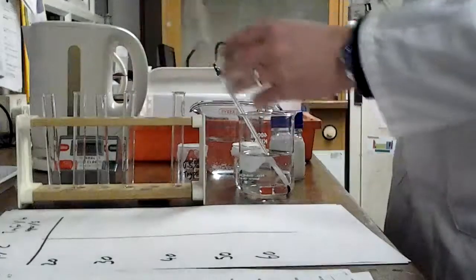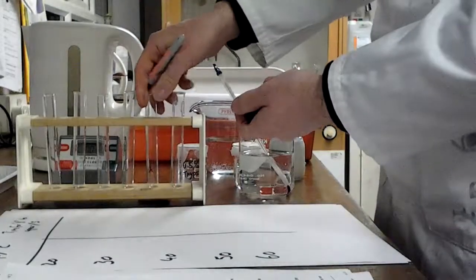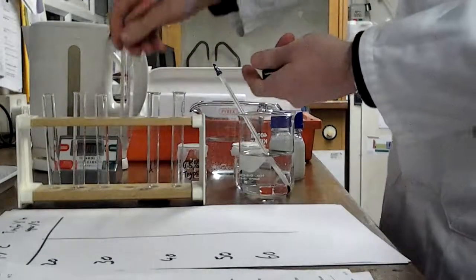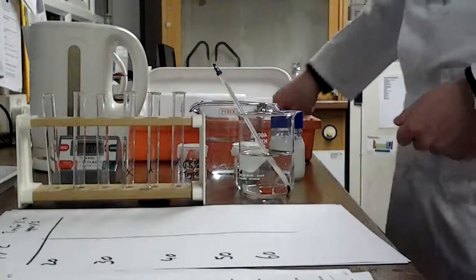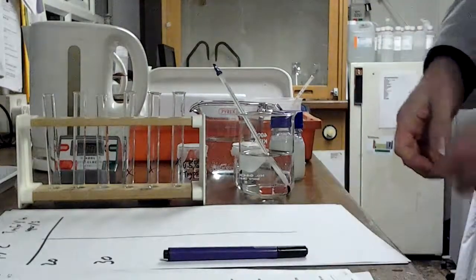So on these 3, I'm putting an X. Notice where I'm putting it. It's not at the top, it's relatively far down the test tube. And there's a reason for that that will become apparent in a moment. I've tried to be relatively consistent with the size and colour of my X so that they are all the same, because obviously that would be a variable we need to keep the same.